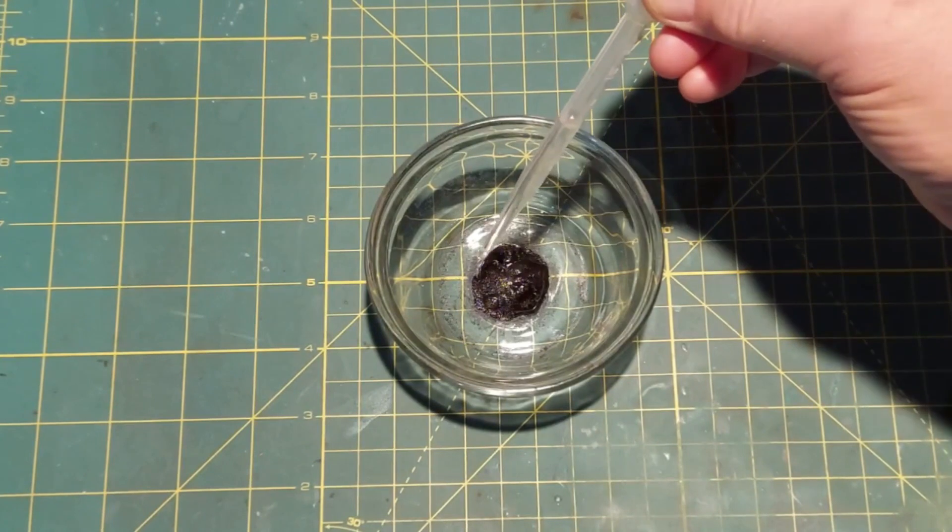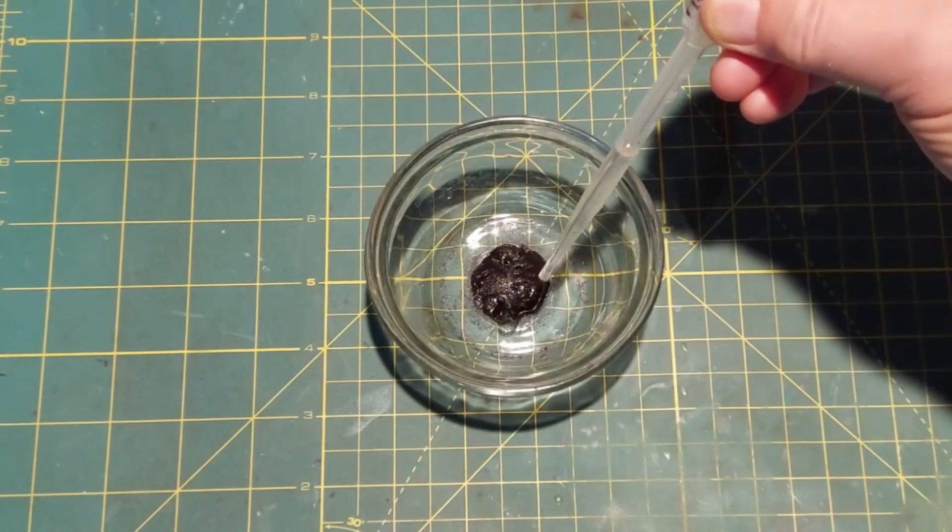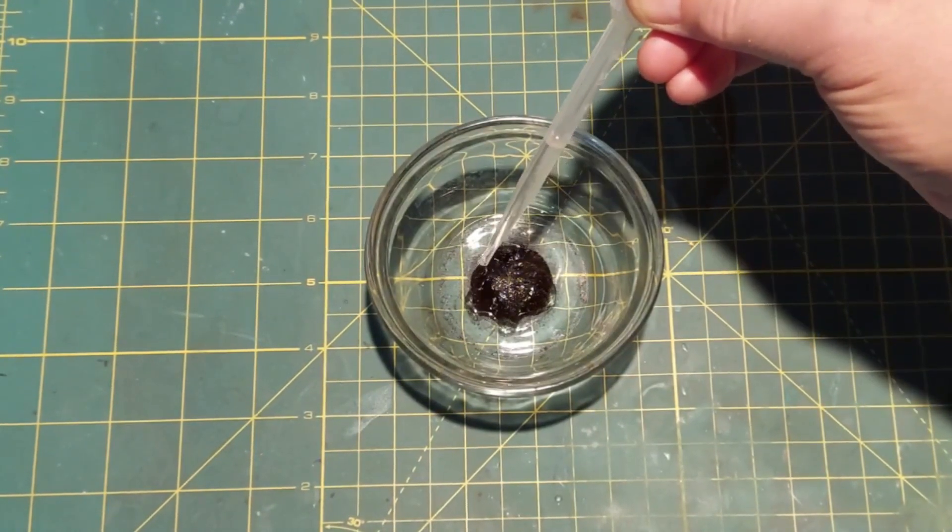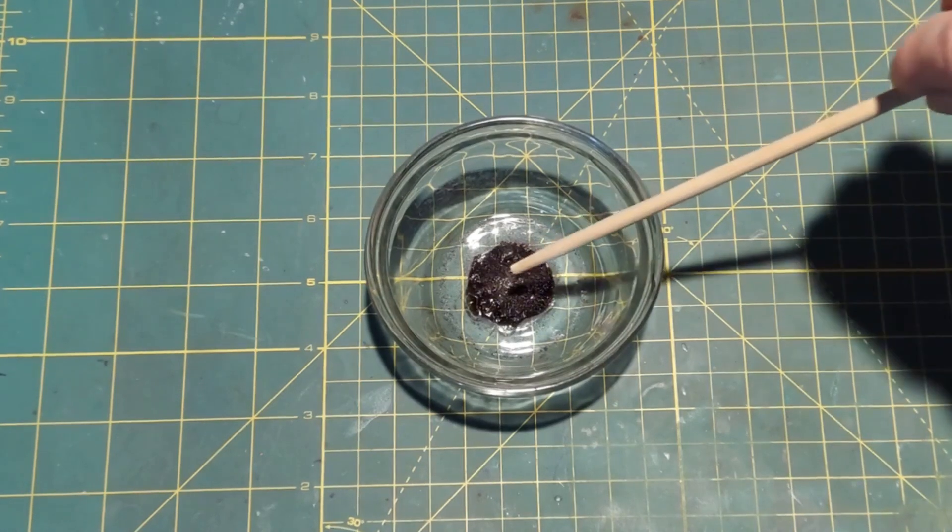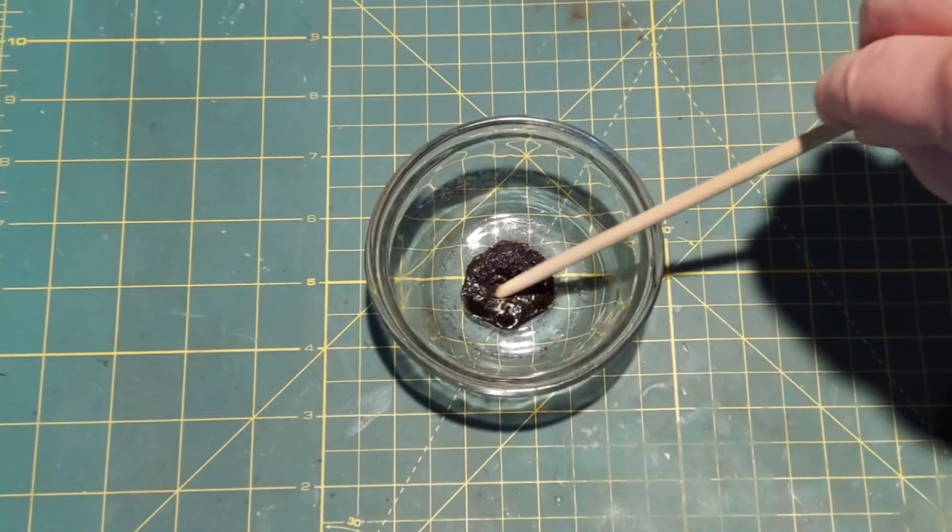However, the manganese heptoxide does take a couple seconds to start up. So we're going to let that sit for maybe a minute and then start dropping things into it. To make sure it's mixed well, I'm going to do just that.